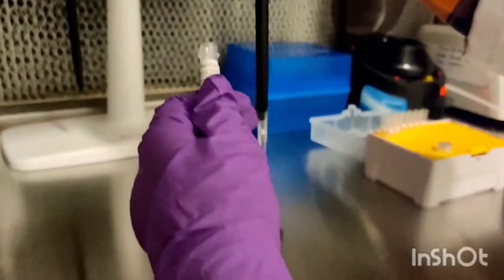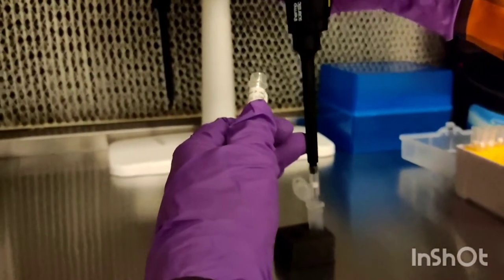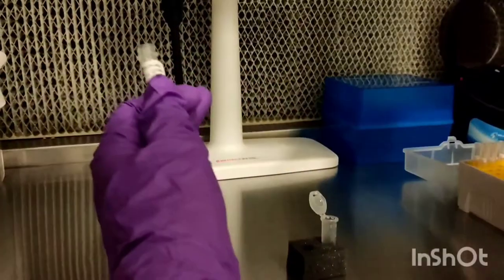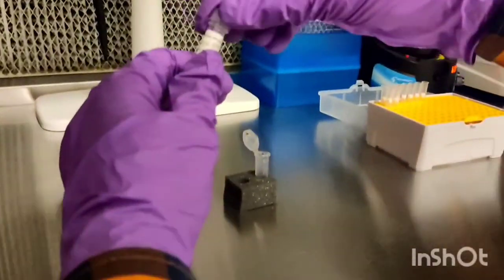In the MCT, primer and probe need to be kept in the dark and away from light sources to avoid reduction in fluorescence.